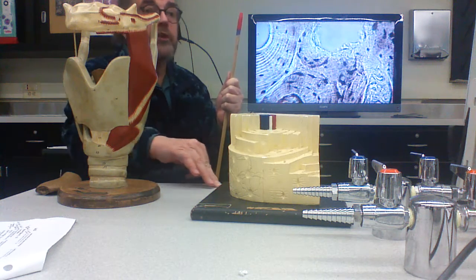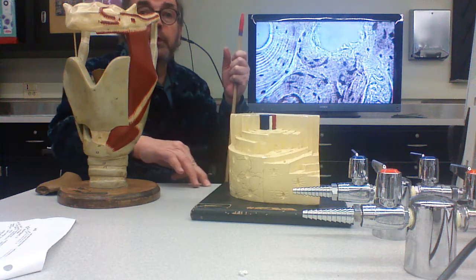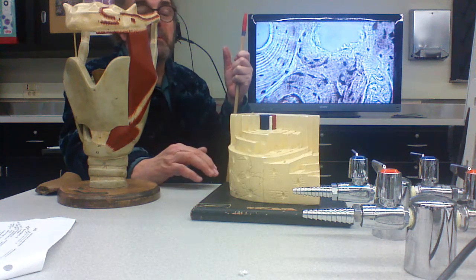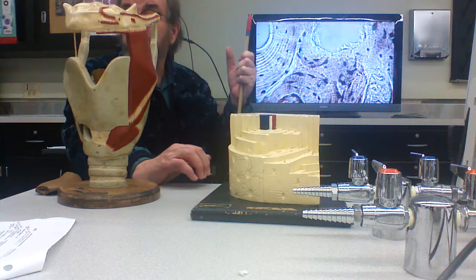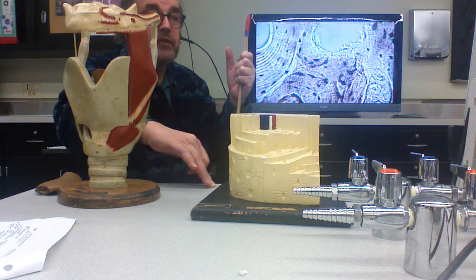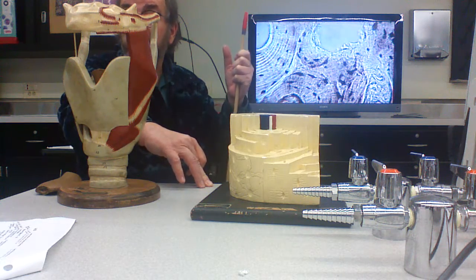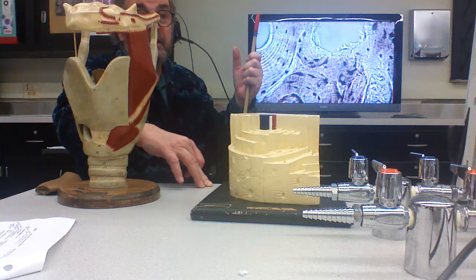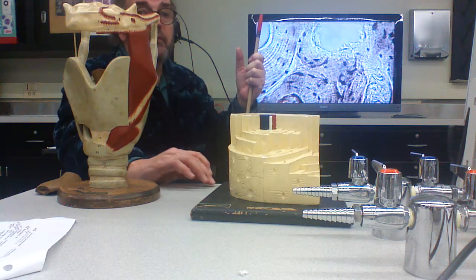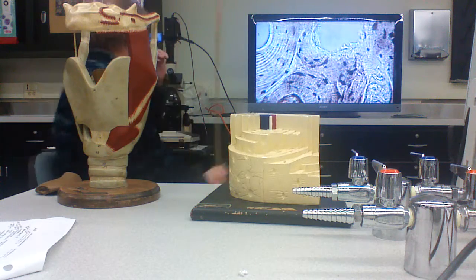You start with sandpaper and emery paper, and eventually you use optical grits, like 600 mesh, 1200 mesh, and you polish it and grind it as thin as possible. And let me tell you, two cells thin is pretty thin. It takes patience to do that. Then you rinse it off in water, mount it on a slide, and it looks like this.